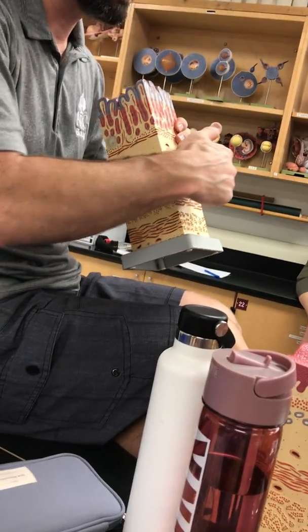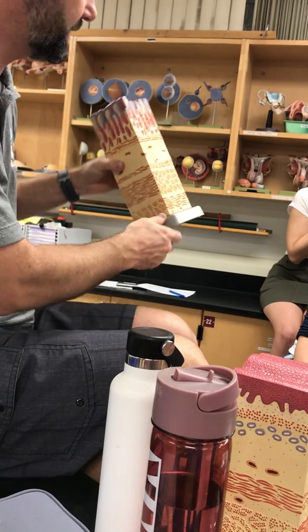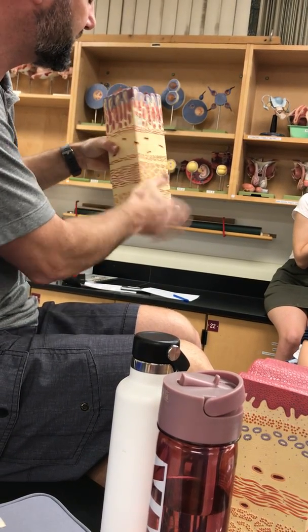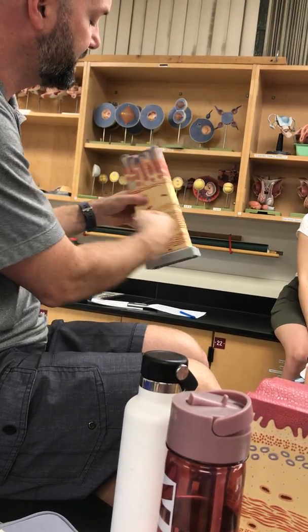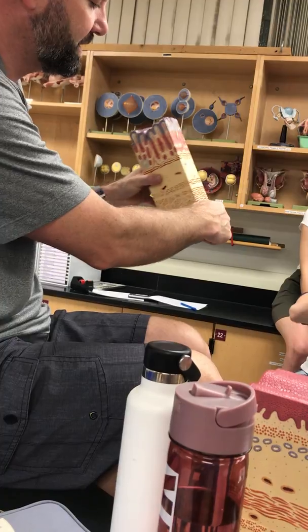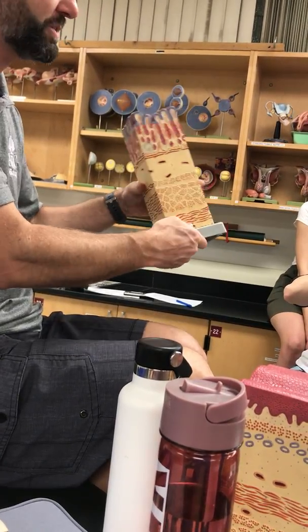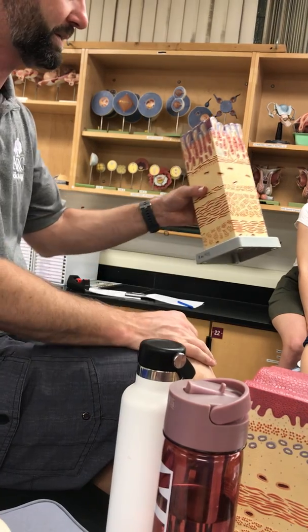How about this layer here? Right, and the angle will determine whether you're looking at it in cross-section or longitudinal. So this is the innermost oblique, followed by the inner circular, followed by outer longitudinal. So I always call it inner circular, outer longitudinal, but when you have the third layer, it's innermost oblique.